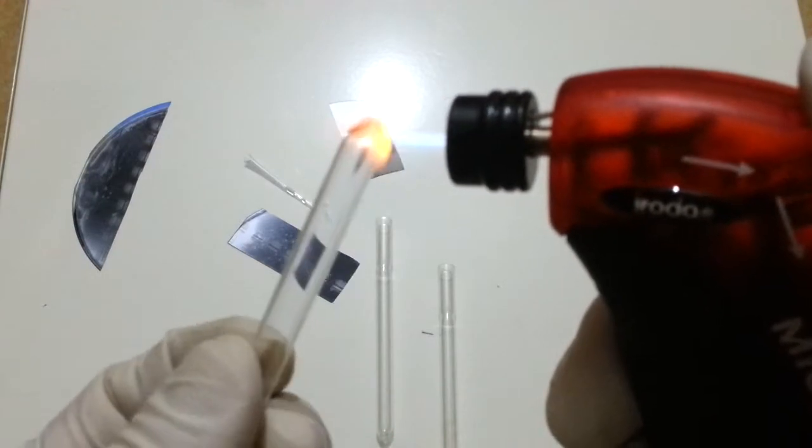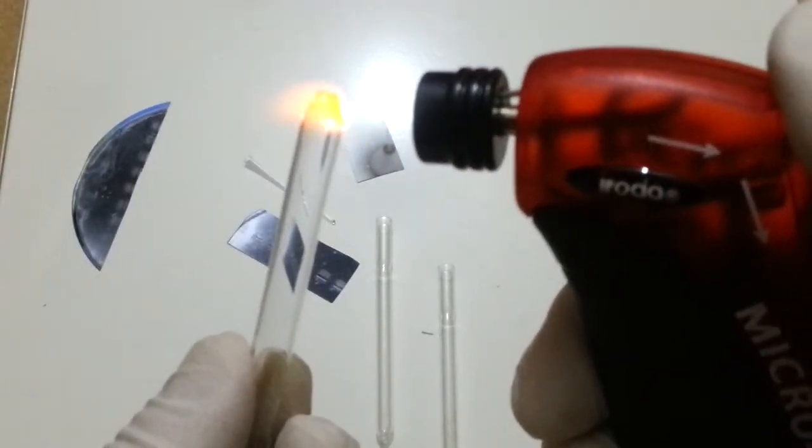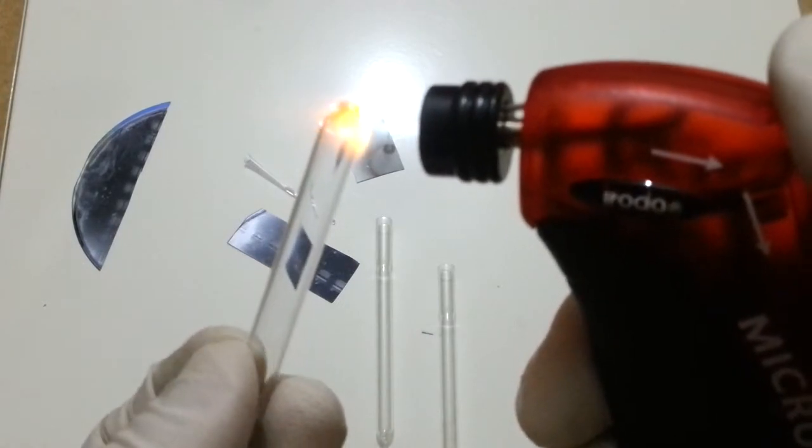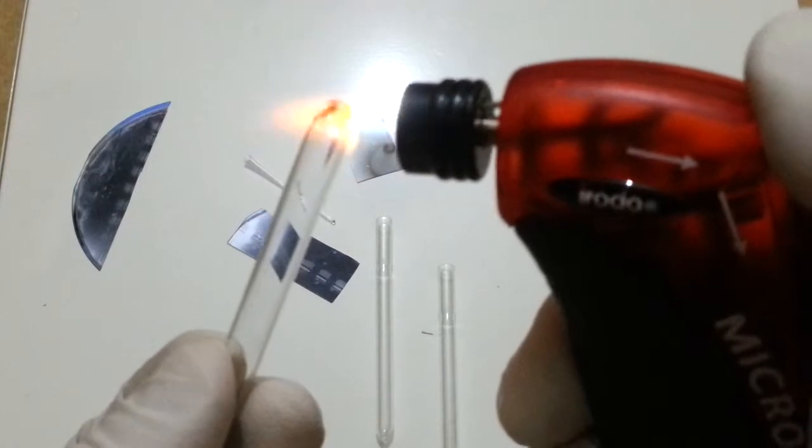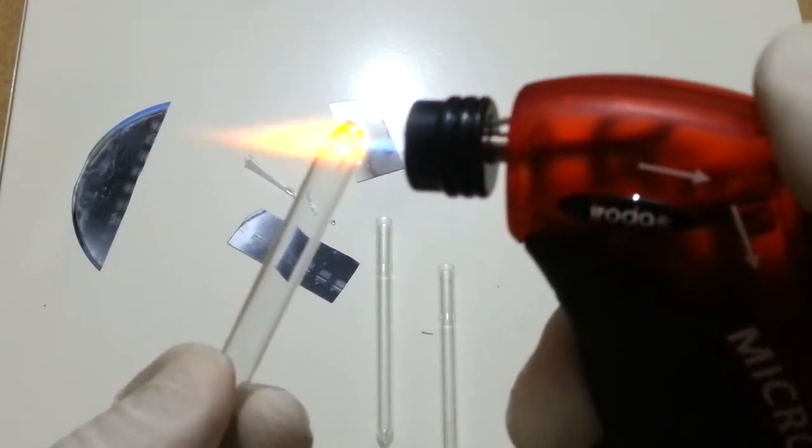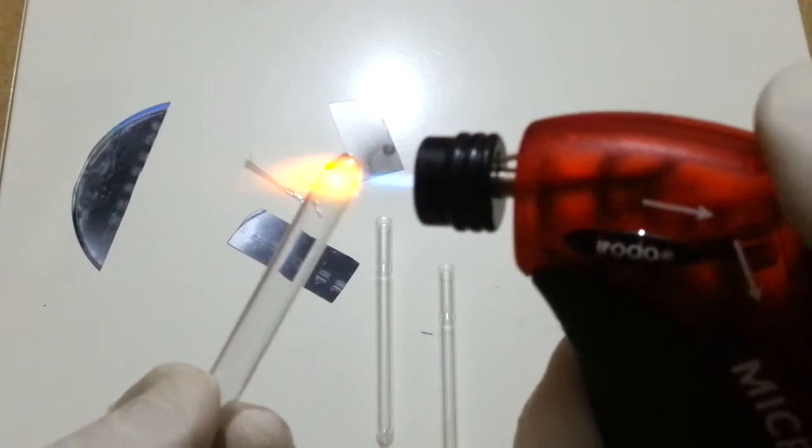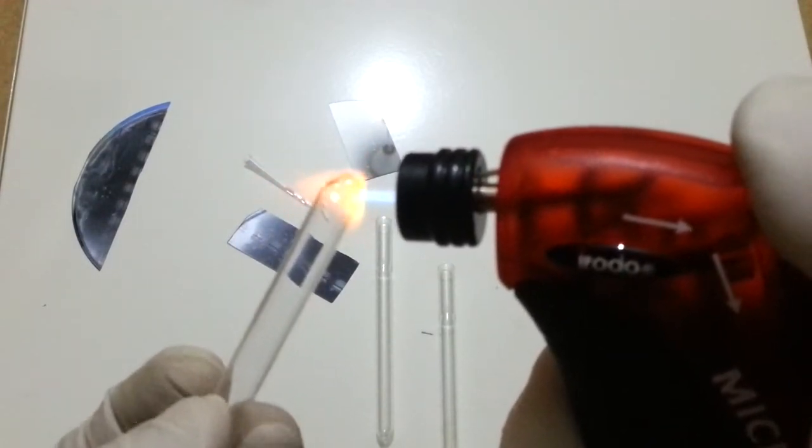Do rotate the pipette. This is going to look ugly, but whatever, because with one eye I am looking at the screen of my mobile phone and with the other I am trying to look at what I'm really doing.